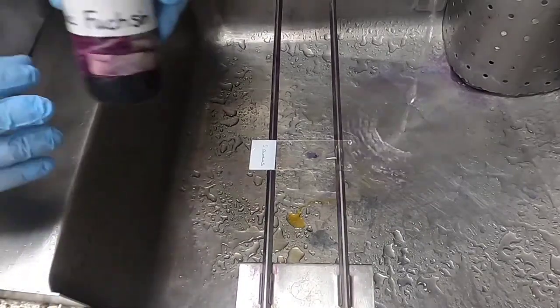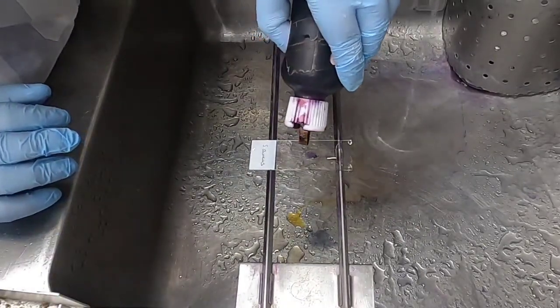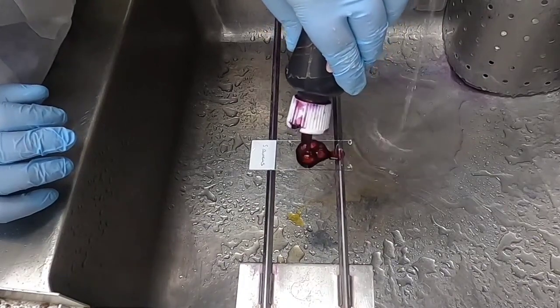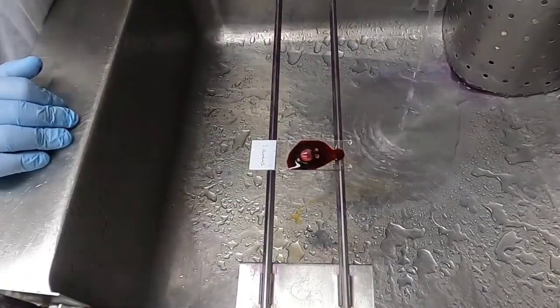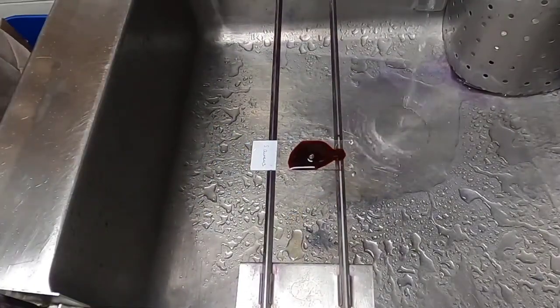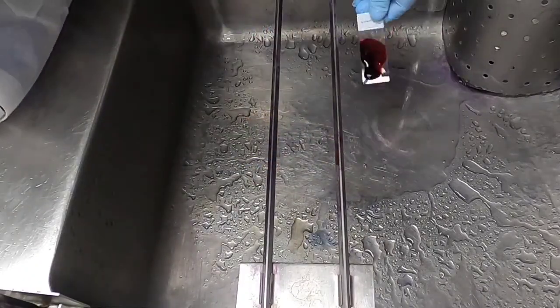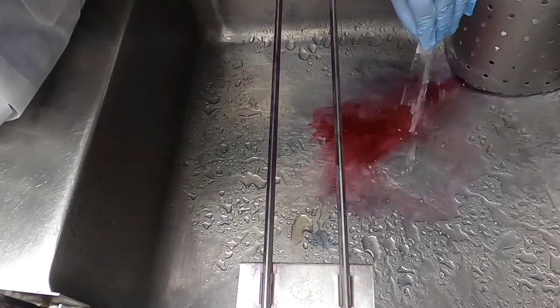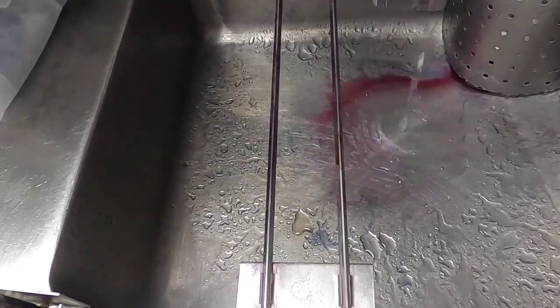The final step is to apply the counterstain — in this case basic fuchsin — which is what makes Gram negative bacteria look pink. Flood the slide with the stain, let it incubate for 30 seconds, then rinse it off. Once the slide is rinsed, you can blot it dry and you are ready to visualize your specimen under the microscope.